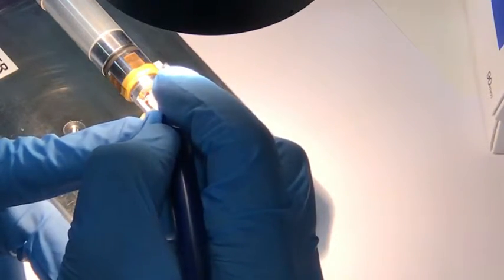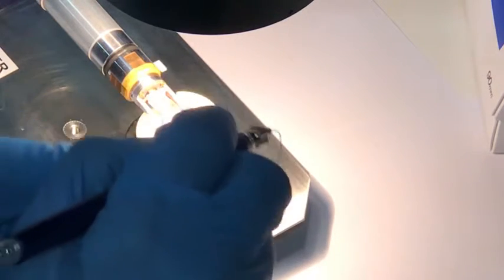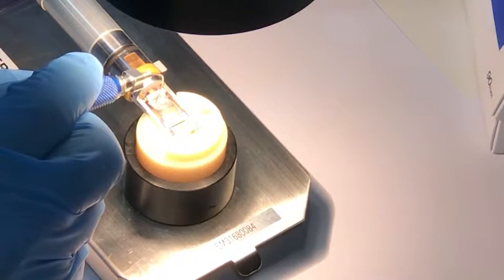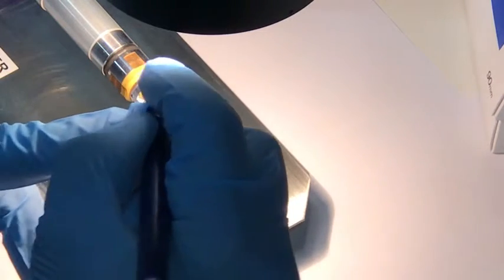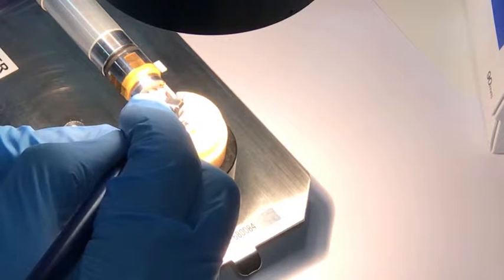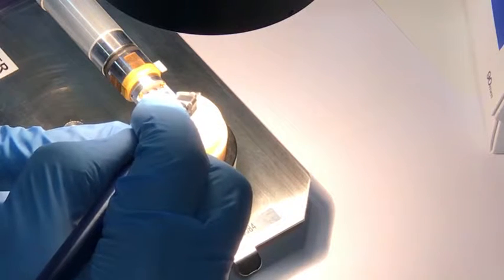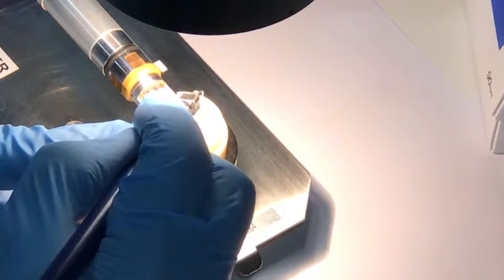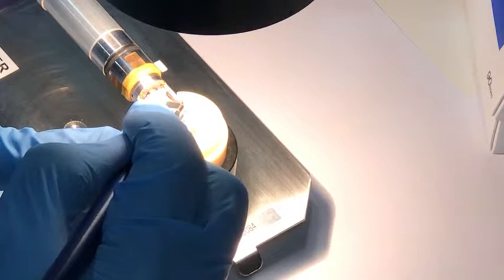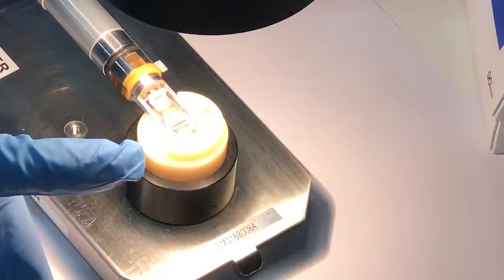That specimen is actually from 2011, so it's 8 years old. Because we've looked after it very carefully, it has given us a lot of excellent data. Just putting the little beryllium washer back in its housing in the slot, and oh, this is fiddly work. Right, that's that.